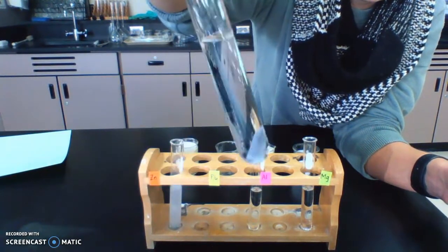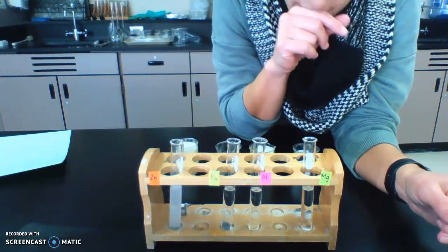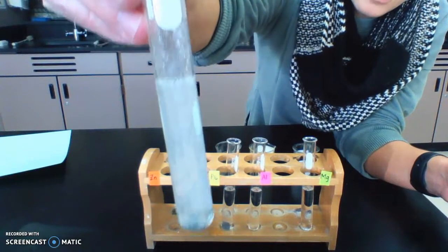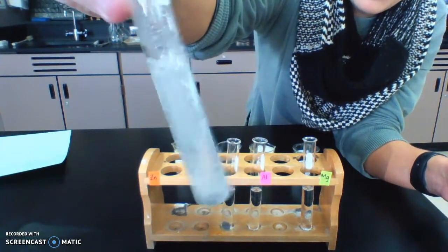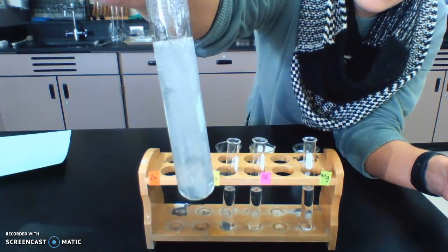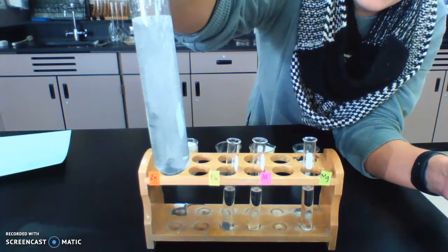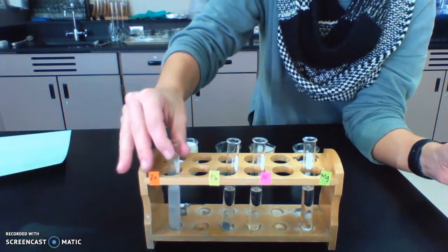Nothing. We'll let it sit here for a while just to check, but so far we've got nothing. And our zinc is still going and still pretty vigorous. It's actually broken apart into multiple pieces now. You can see it moving around some of the small pieces up through the bubbles. So this is fairly vigorous, yep, and it's getting warmer still.